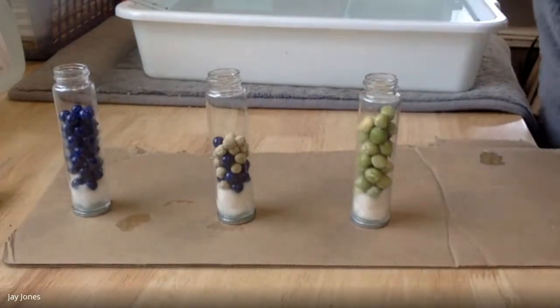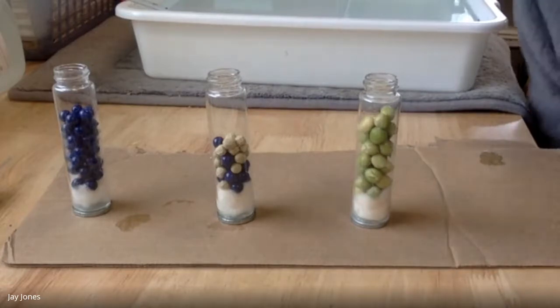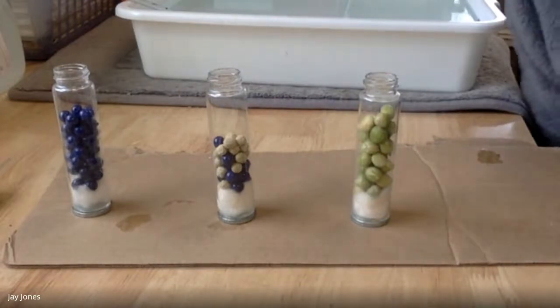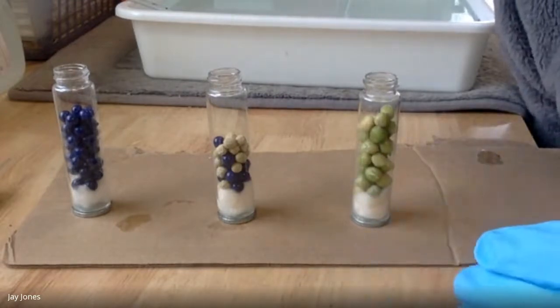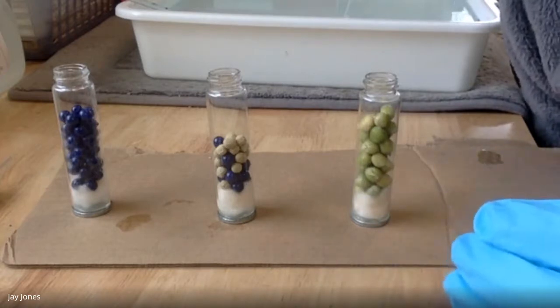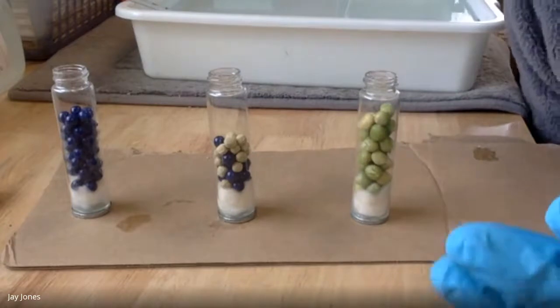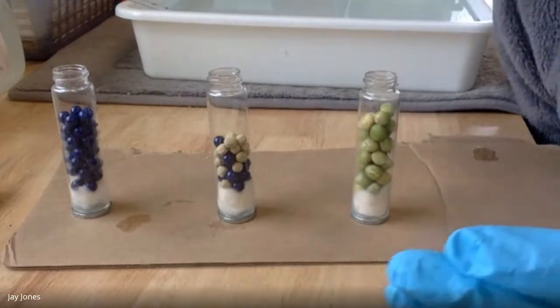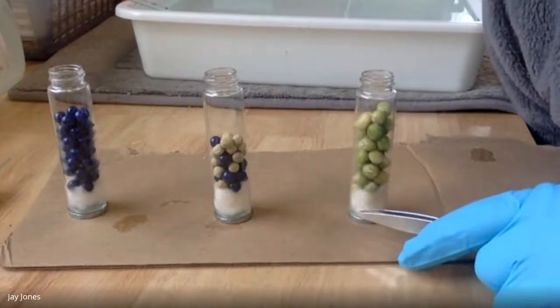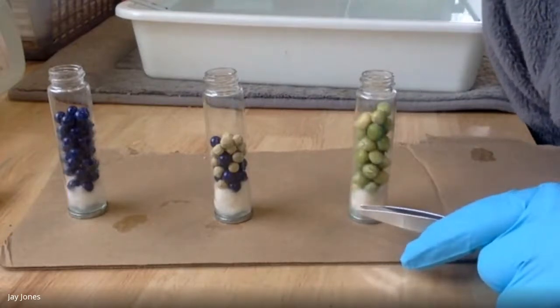The problem is that carbon dioxide is made and oxygen's consumed, if it's aerobic cell respiration. We can't deal with that, because oxygen's consumed but CO2 is made. Yikes, what are we measuring? So we have to cancel one of those, and we're going to cancel out the CO2. The KOH is going to combine with the CO2 to form a salt.